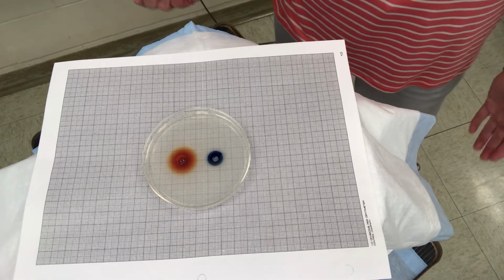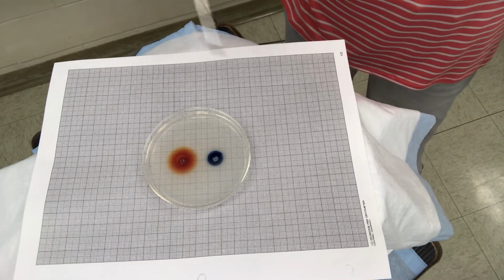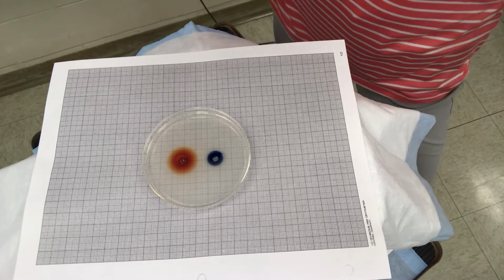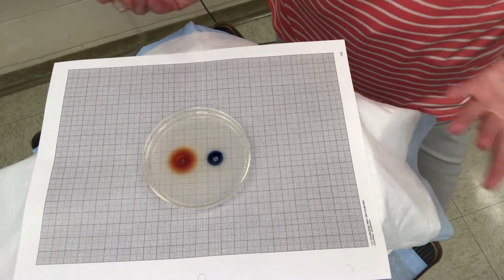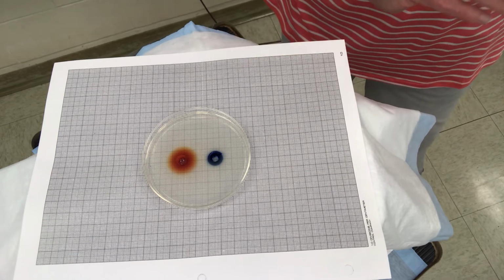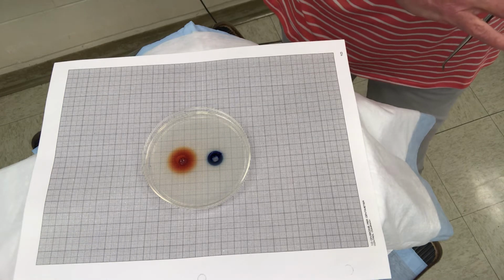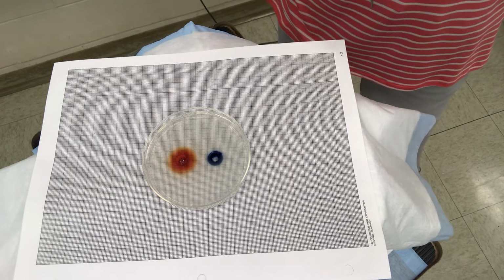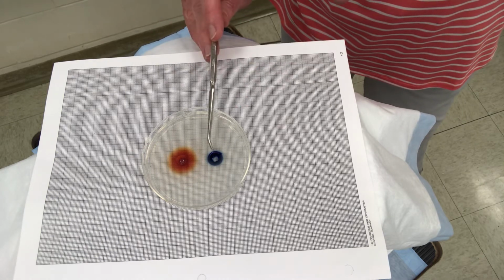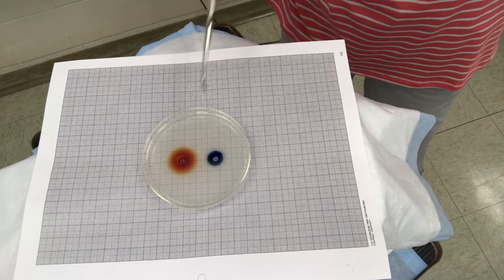We did it over a 60-minute, or an hour, period. We could divide this by 60 minutes to get the diffusion rate per minute, or we could divide it by how many hours if we ran it for 2 hours to get diffusion rate per hour. Comparing the diffusion rate in the gel to the diffusion rate in water, molecules diffuse much quicker in water. And comparing the size of the molecules, the larger the molecule, the slower the diffusion rate. The smaller the molecule, the faster the diffusion rate.